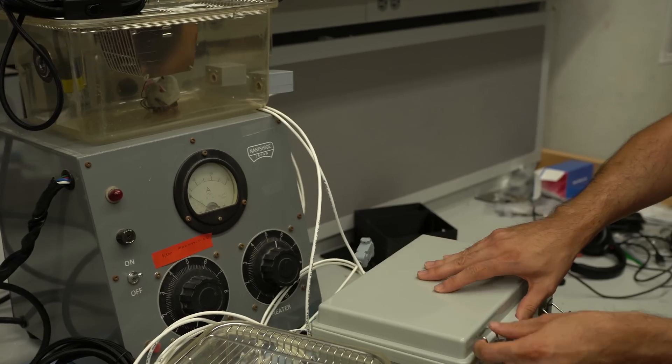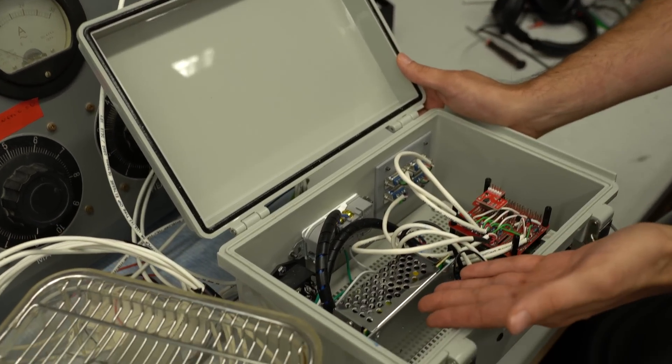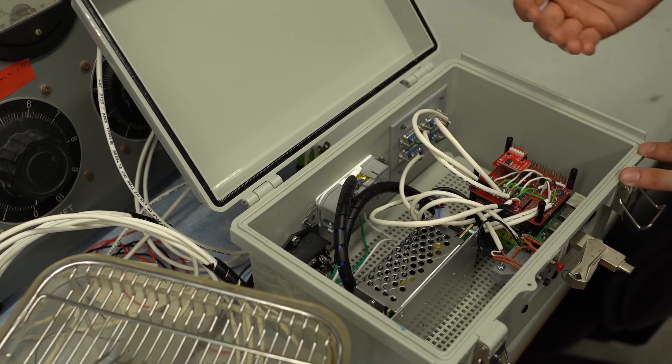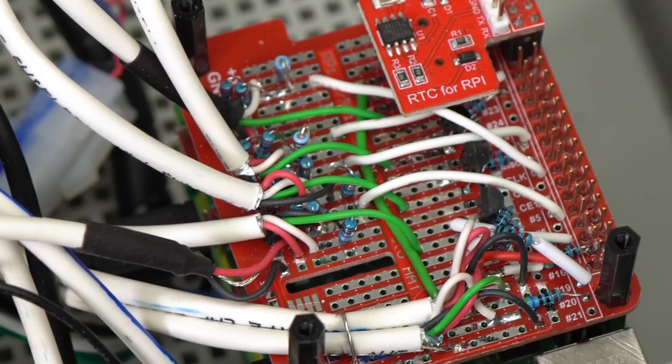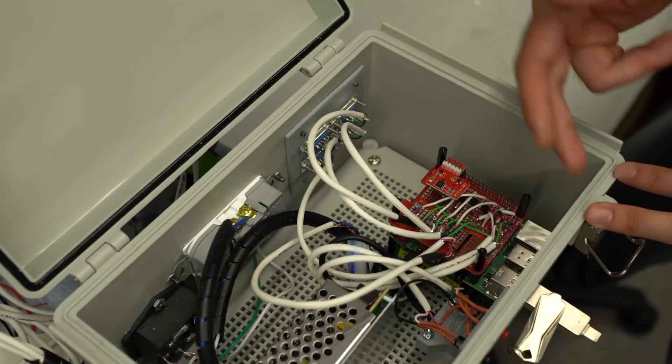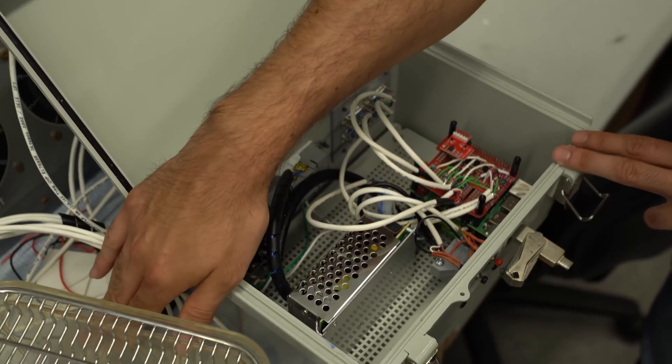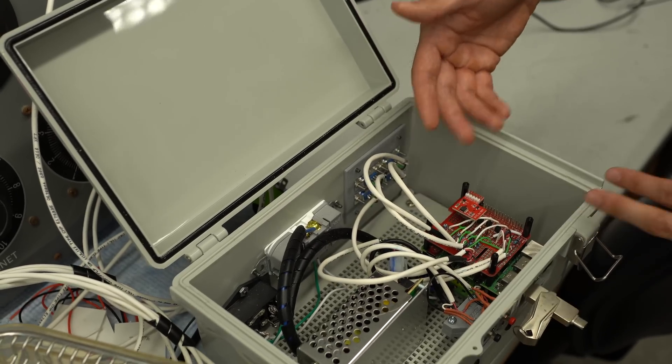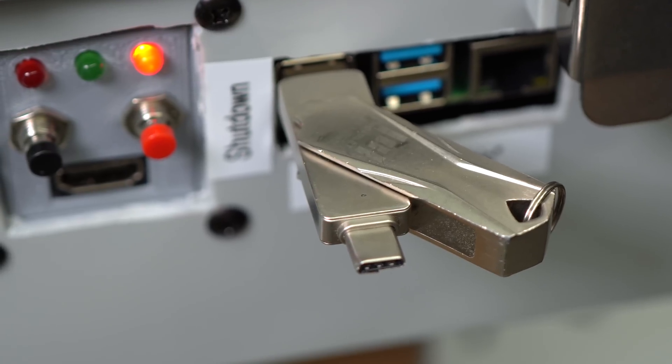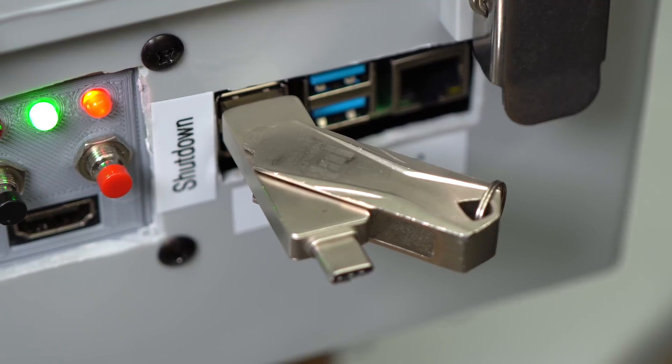These are connected via a serial port with our Raspberry Pi in here. So once again, we've got another power supply to power it off wall power. We've got a real-time clock and a relay. And at the bottom here, we've got the Raspberry Pi. And so this reads the voltage changing off these nose poking devices and then sends voltage either to the heat lamp. So right now I'm recording the data to this USB, but I could also use VNC to get in and view the data.